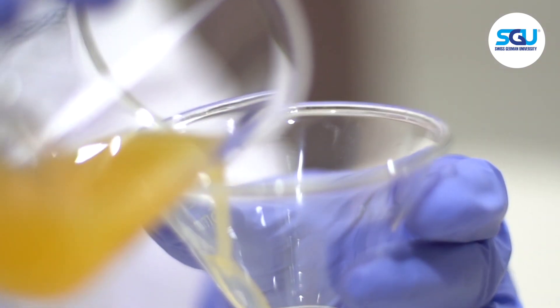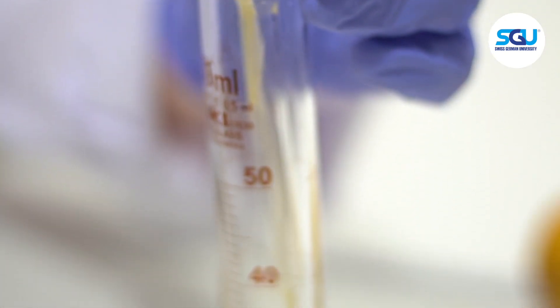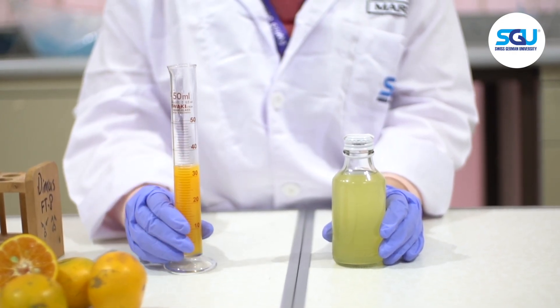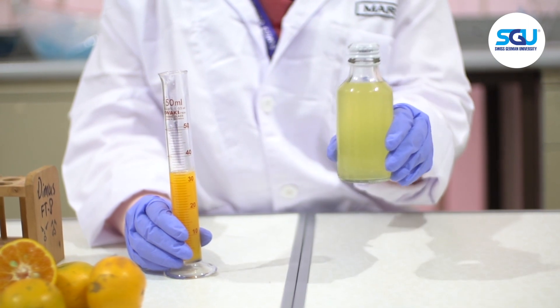The total volume of juice from one fruit that was squeezed was approximately 34 ml. The orange juice is ready, as well as the commercial vitamin C drink.